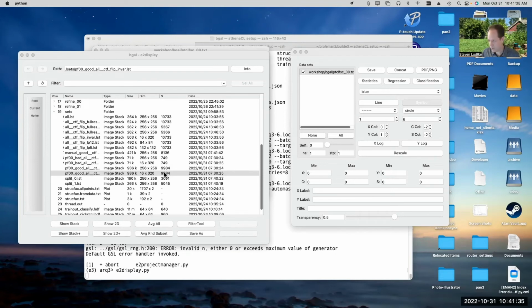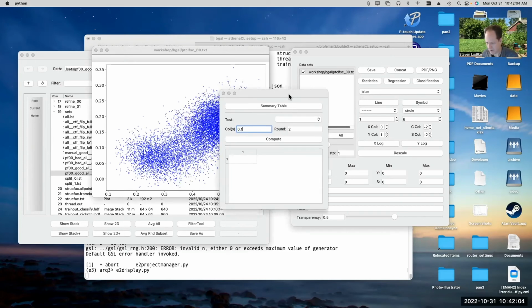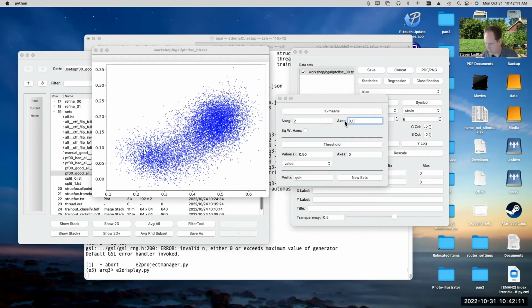But if you go through the tutorial and you use the particle data set that they provided, the ones they had picked, it's actually more like 15 or 20% of the particles that they had picked are actually not very good. So you're like 5,000 and 1,000, something like that. So then it actually can make a big difference if you get rid of them. Anyway, it does this automatically, and the way it does it is by doing what I was showing you here. It picks a specific set of columns that it knows are useful.